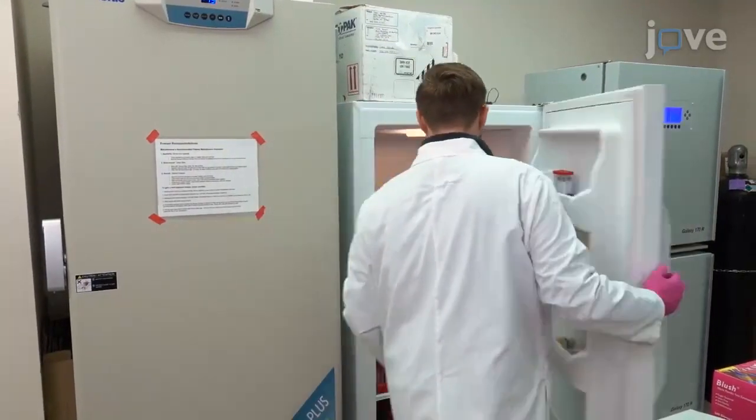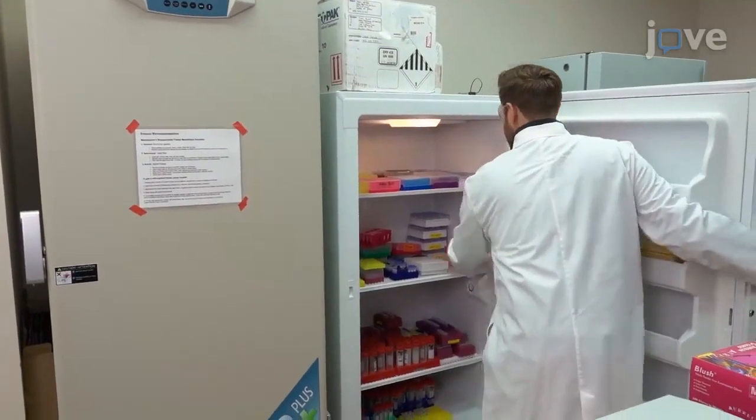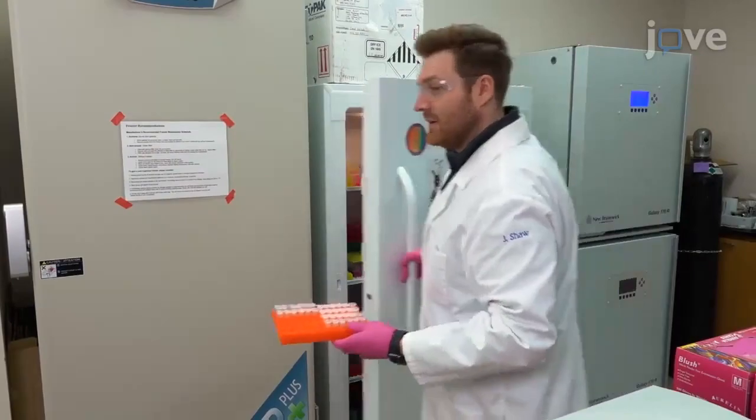Begin this procedure with engineering of genetic markers onto bacterial chromosomes as described in the text protocol.